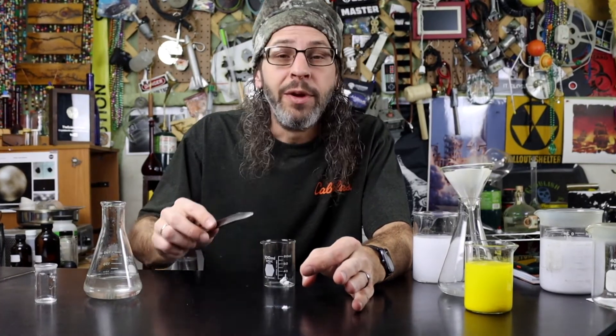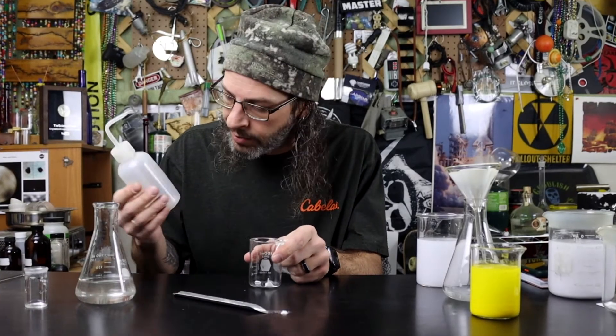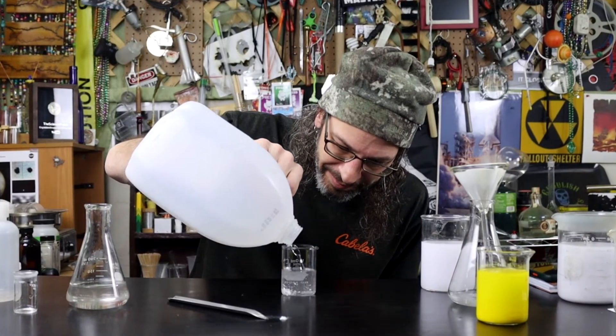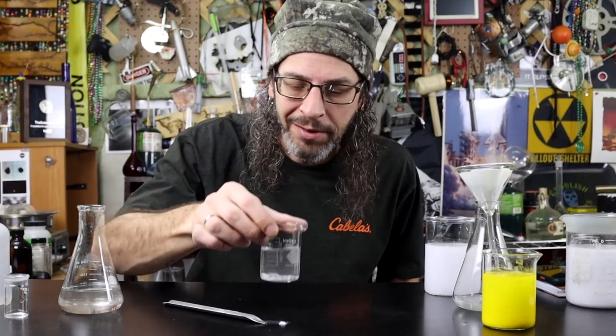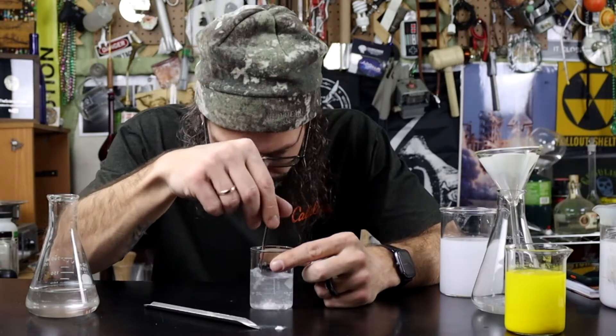I just wanted to show you how insoluble silver chloride really is. Put it in a little beaker, add some distilled water, and right away you can tell it doesn't really want to dissolve — it's sitting on the bottom. We could stir it all day long and it's not actually going to dissolve into the solution. It might disperse and make it look a little milky, but if you let it sit it all settles back down to the bottom again. It precipitates — it falls to the bottom. That solid is actually a little more dense, a little heavier than the solution that it's in, and so it wants to be at the bottom. That's why we call it a precipitation reaction.